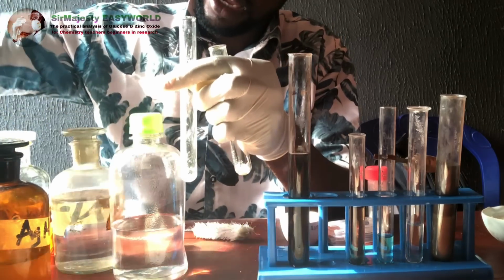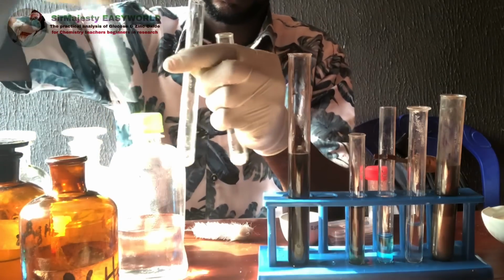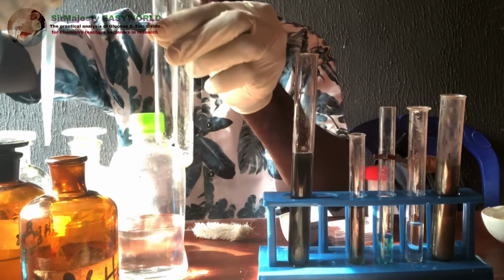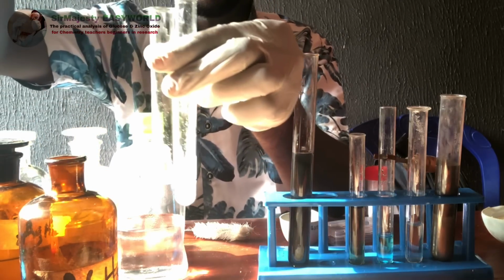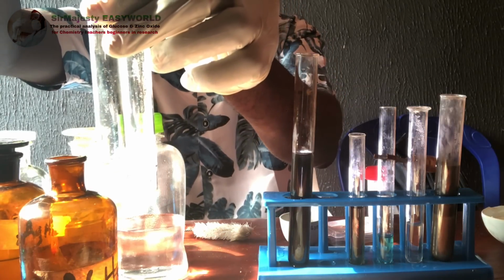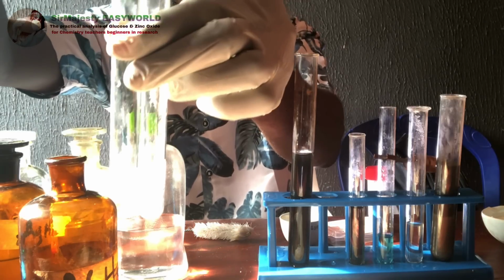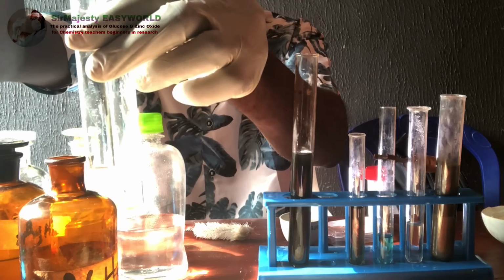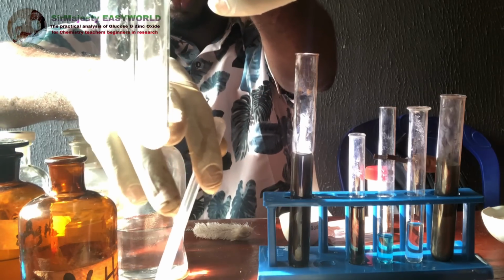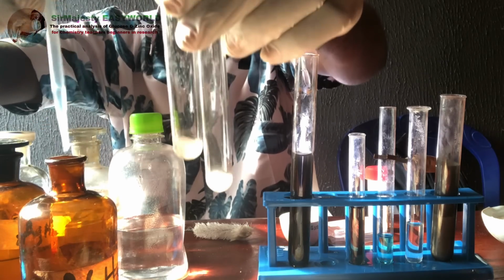So over here is my HCl, dilute acid, dilute HCl. So I want to use this acid to distinguish between them. Over here, you see, there is no visible reaction, but it will eventually dissolve. You see it dissolving with time. But this one here is purely zinc carbonate, and this one here is zinc oxide. So if you heat both, they will turn yellow.